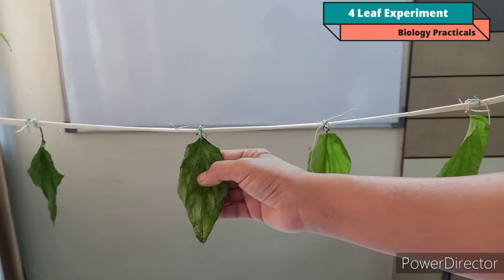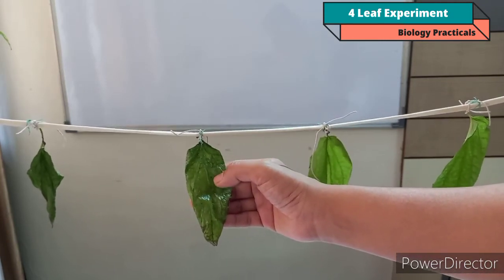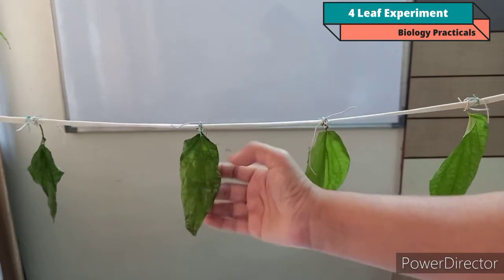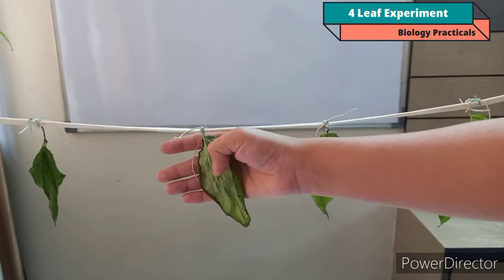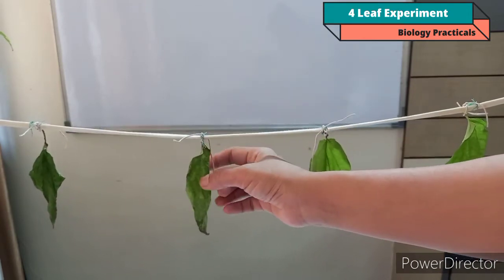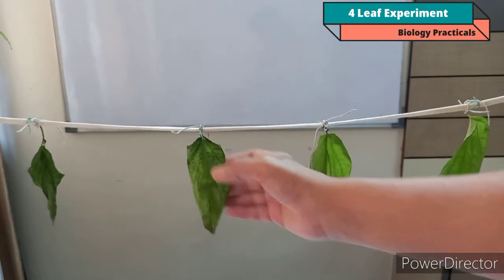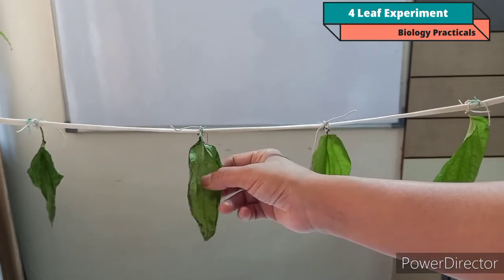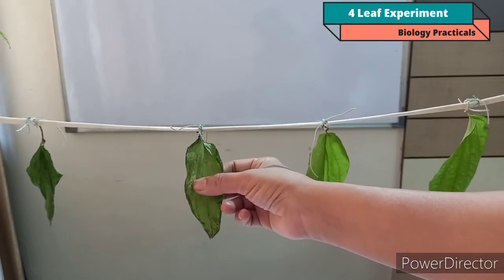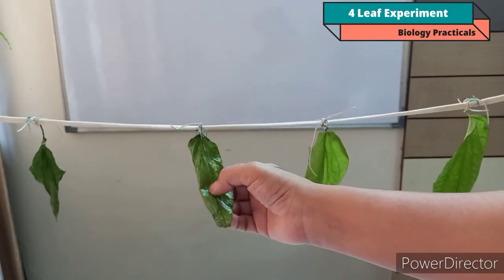Now look at leaf C, which is Vaselined on its upper surface, which contains a smaller number of stomatas. So here transpiration takes place from the lower surface with maximum stomatas and the leaf shrivels to a large extent. So leaf C shows more wilting than the second one, because here transpiration occurred from the lower surface of the leaf, where stomatas are more in number as compared to the upper surface.